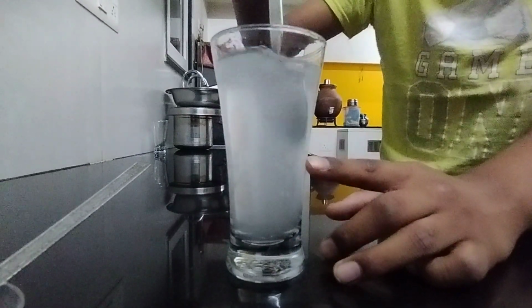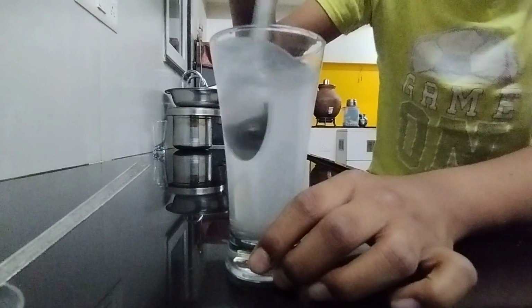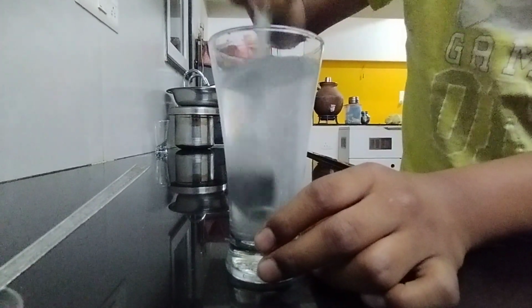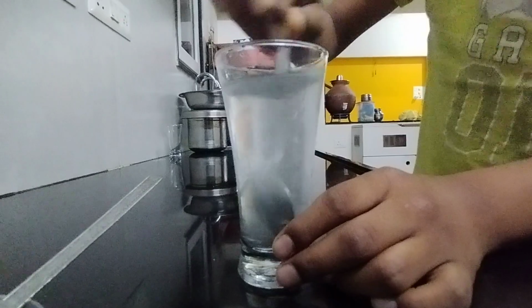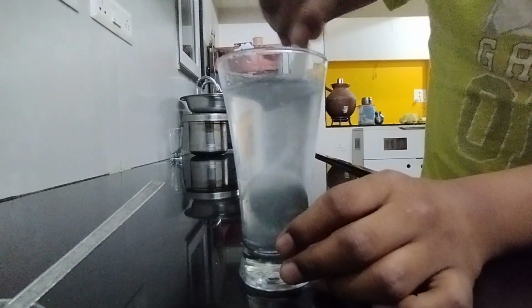The water's color changed because it is still adjusting. In that process the color of the water will change into the salt color, that is whitish. You can see some water. I am stirring it fast to make it happen fast.